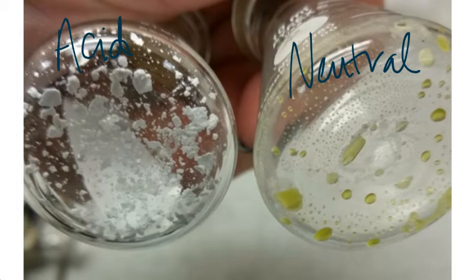So now we're left with the crystals that we were able to recover. Again, we were not able to recover a base because no base was present. We got precipitates for our acid and our neutral layers, and then we check them in the melting point apparatus. We use a capillary tube and we pack it with each of the samples and we test them individually, and we compare their average melting points to documented averages of the samples that are known.